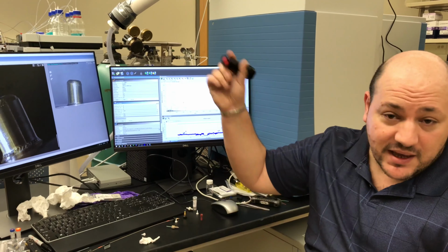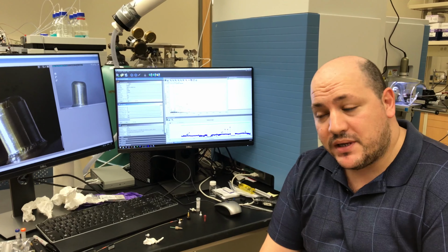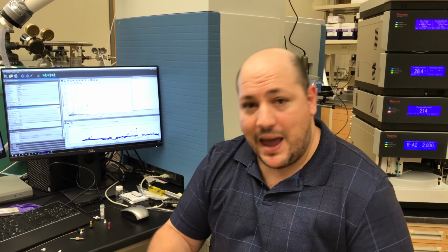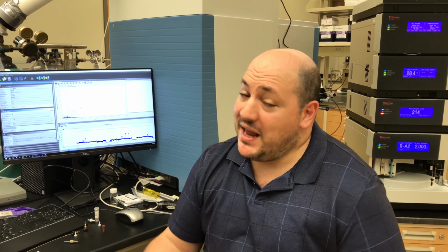On the back we also have another instrument, an ion trap. It's also connected to an LC system, but we use that instrument mostly for protein analysis and for small molecule analysis in a mode that is called MRM, multiple reaction monitoring. Basically, what you can do here is liquid chromatography mass spectrometry of any kind.